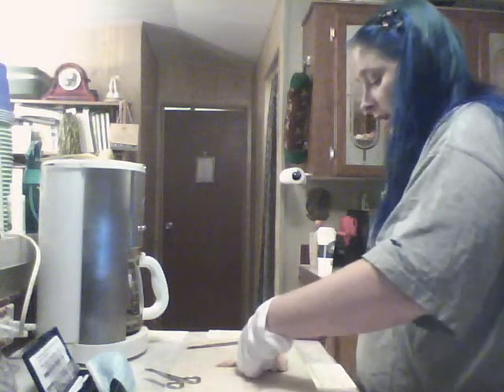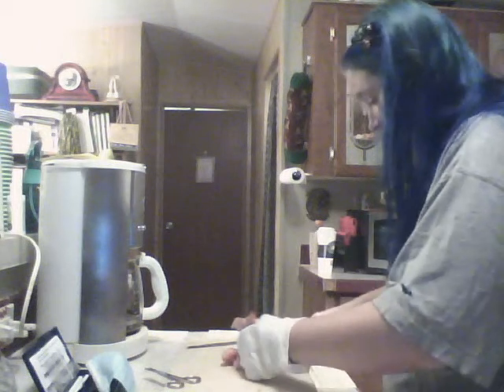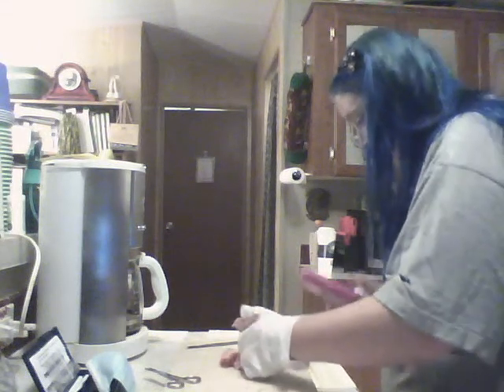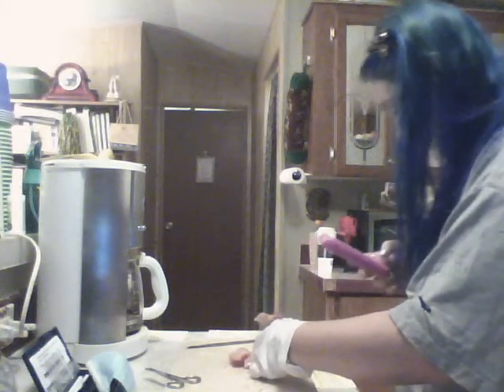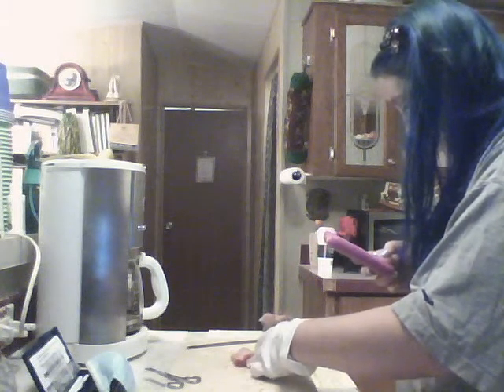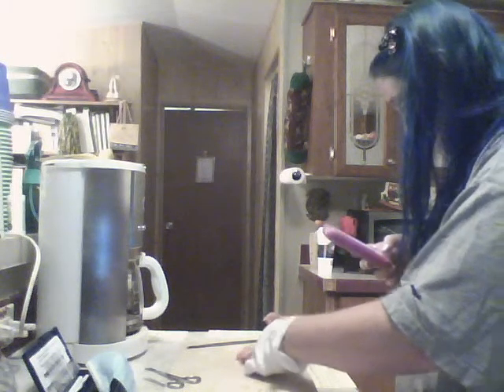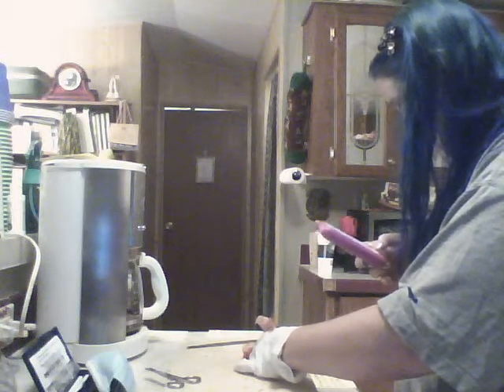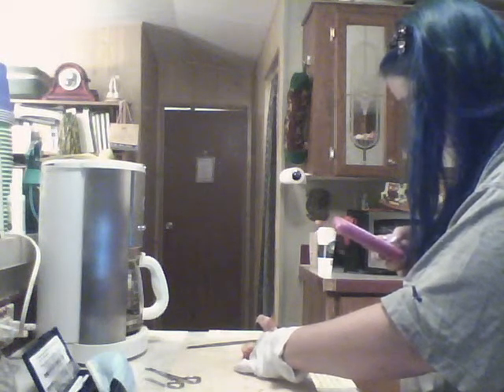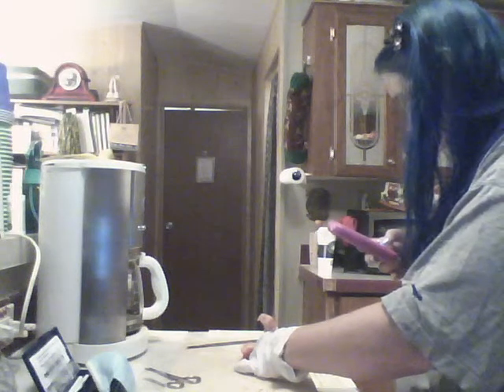This has to be the flexor muscle. Pull this, close together. Okay.